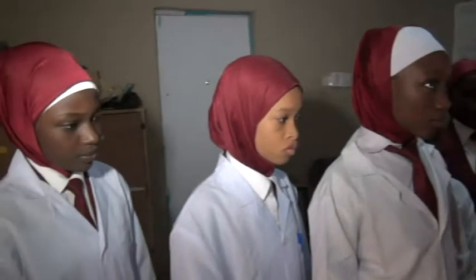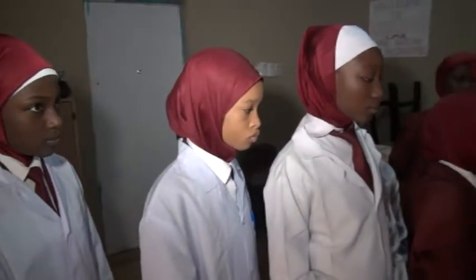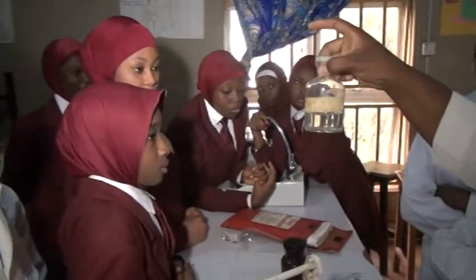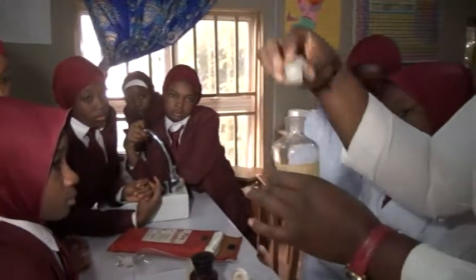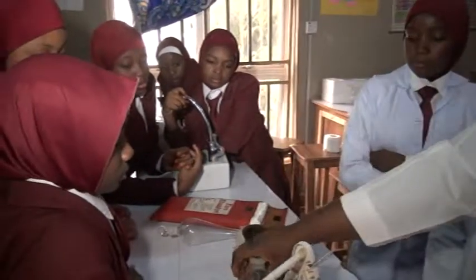Anything that sunlight is going to deteriorate, we use this one. Something like silver nitrate, we use this to collect it. While this one can be used to store any salt or dilute acids. Especially dilute base, we use this because this has a rubber cork. If it is a glass cork, it will stick and will not open again.